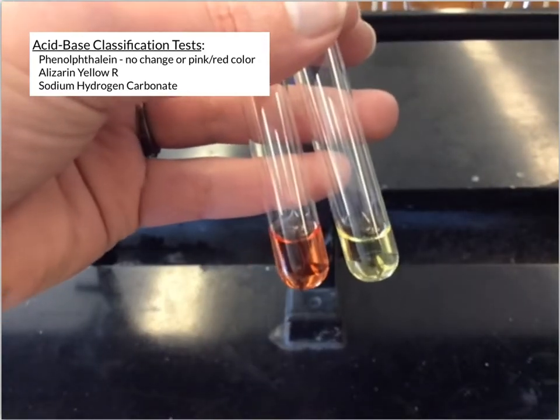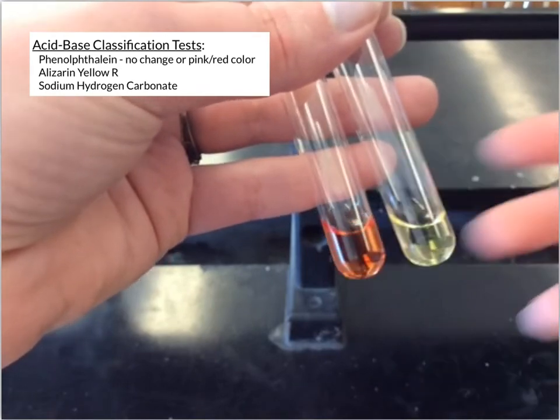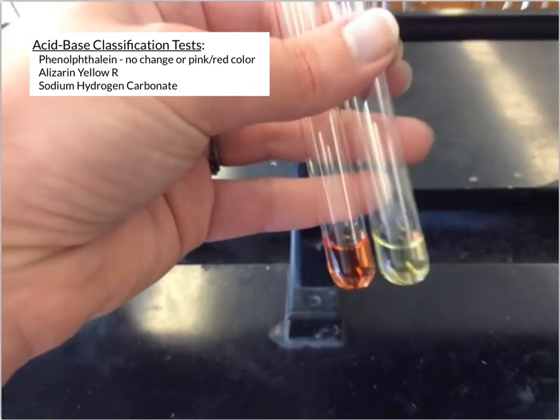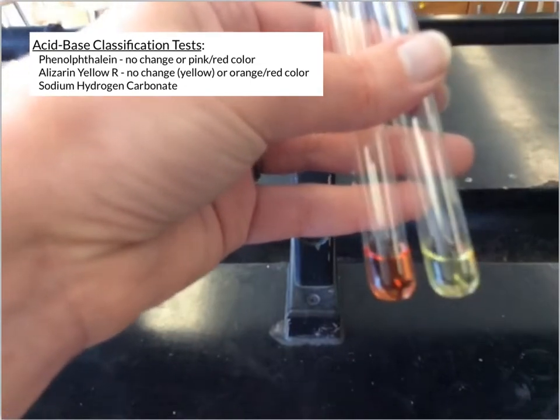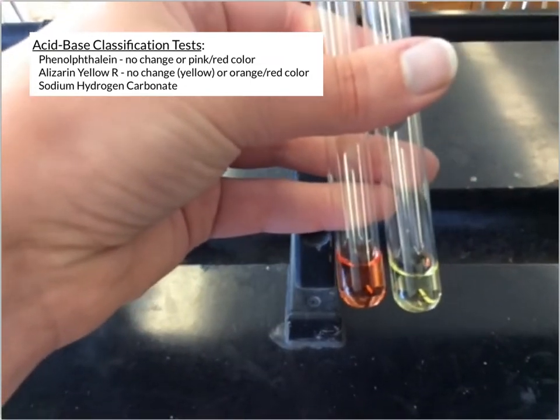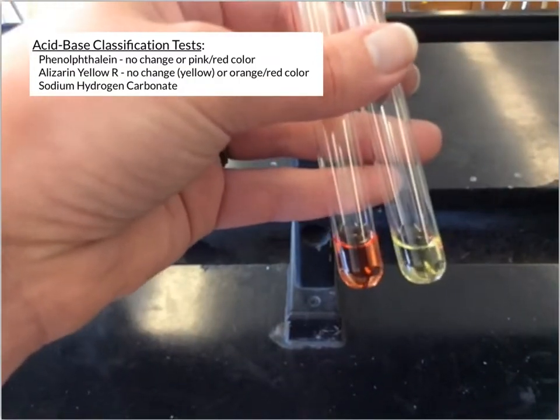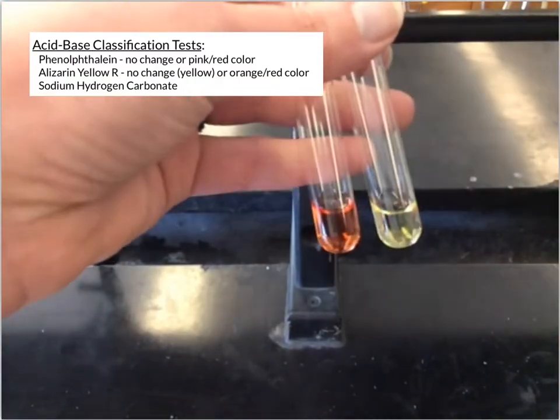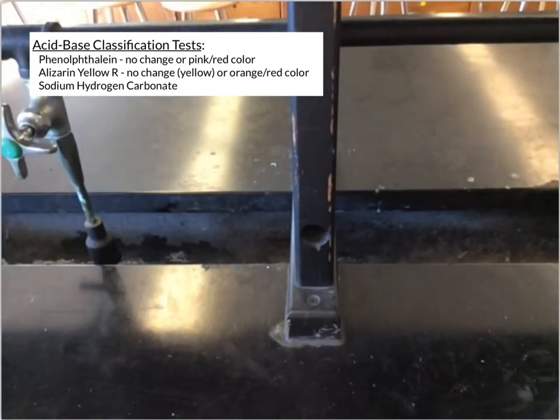But on the left, that's an interaction with the substance in there that causes that color change to that reddish orange color. And so that's what you would see with the alizarin yellow R indicator, is either you see no change or just the yellow color from the indicator, or you see it change to a red or possibly orange type color.